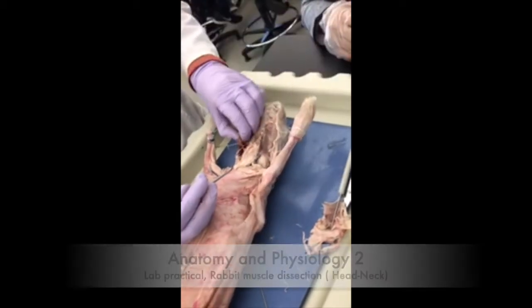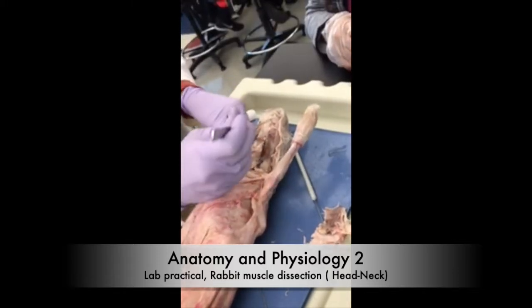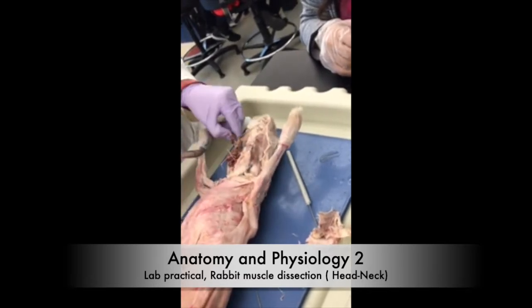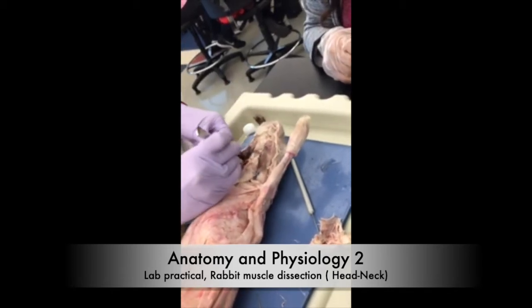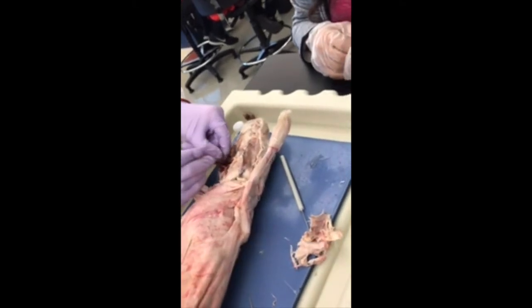Those are glands, you don't need them. Oh, okay. They're salivary glands. We're not going to care about those. They have huge salivary glands in comparison to carnivores.